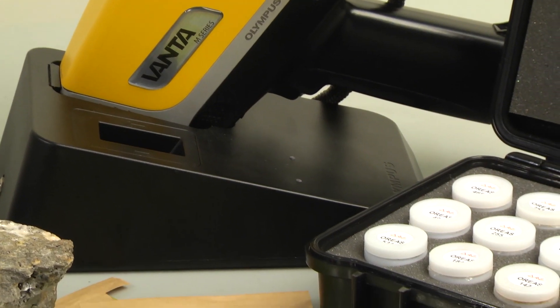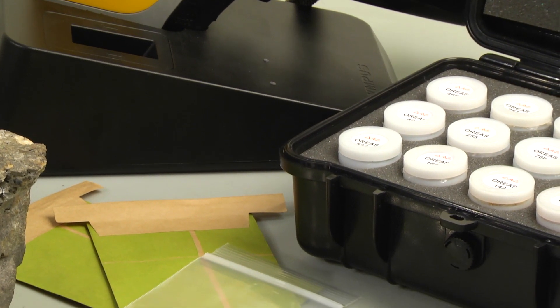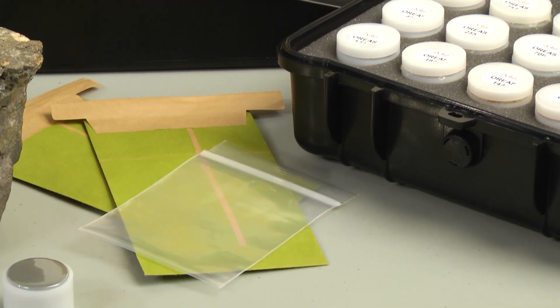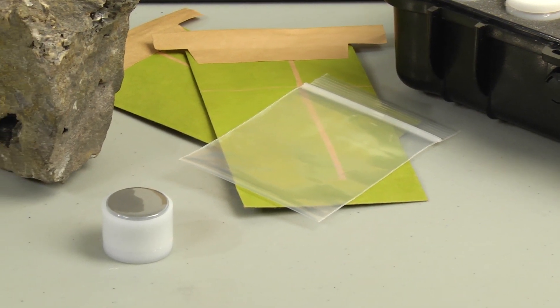To achieve the best results possible, our samples are homogenous and we put them under conditions to ensure minimal distance between the material and the detector. It's also very important for elements titanium and lighter. It's these elements that are more easily absorbed by anything between the sample and the detector.